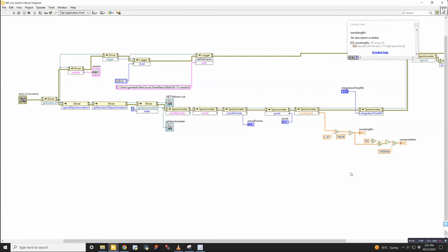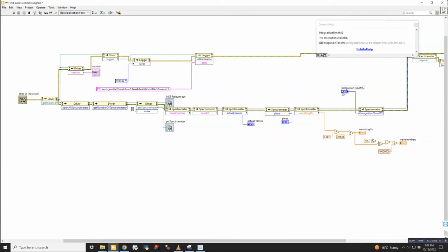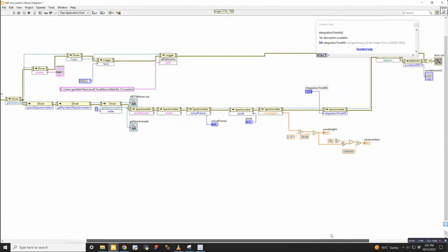This is the Wasatch spectrometer program. So this is the saving path. Yes. And one thing that we put in right at the end is our integration time that we're interested in. By default, this value is 100 milliseconds, but then you can change that to whatever you want anytime that you want.